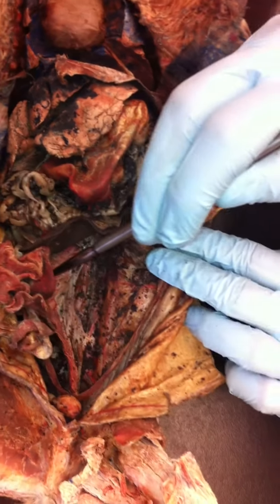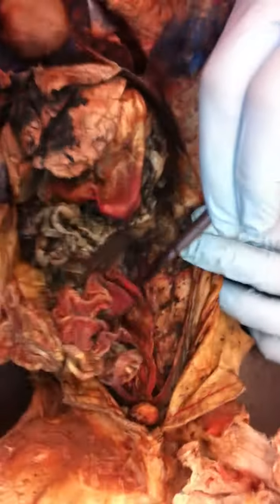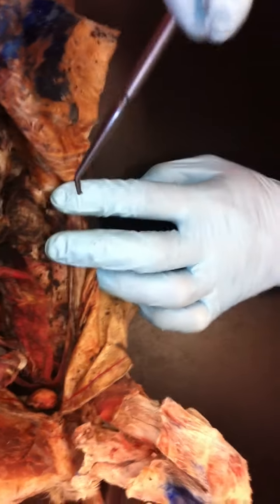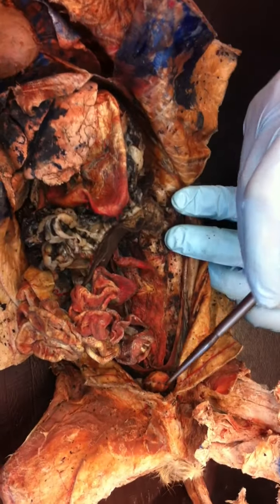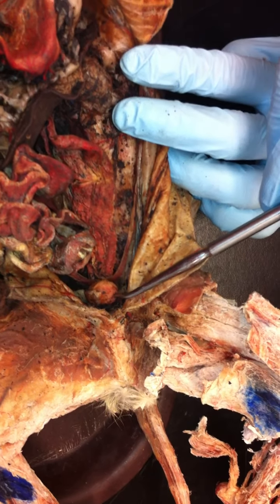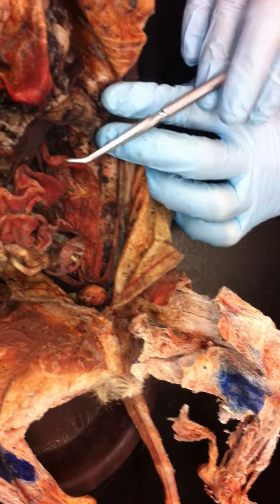So, coming down from the kidney will be the ureter, which you can't really see here, and which is also why I've crossed it off. Okay. That makes sense. But it will then insert onto the urinary bladder. Okay? That little ball right there? Yeah.